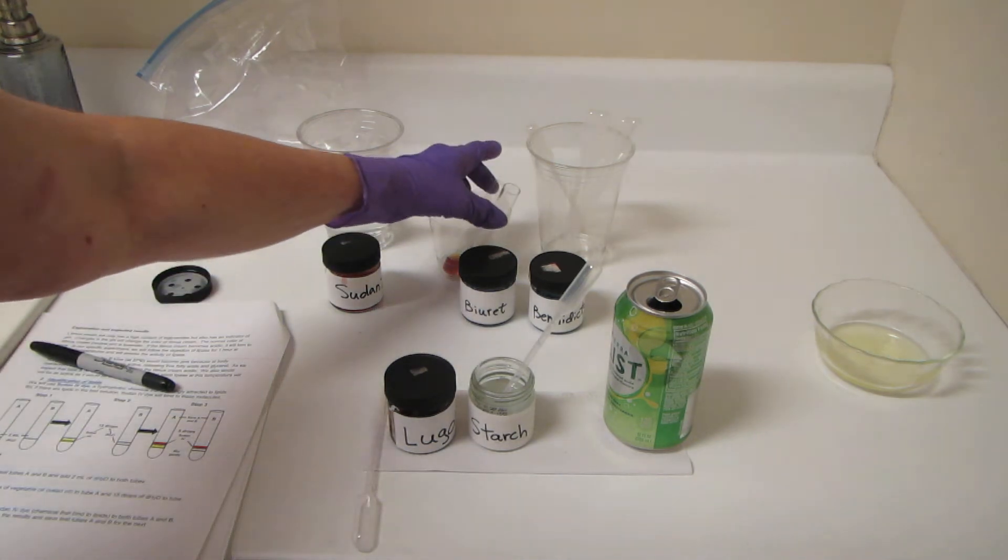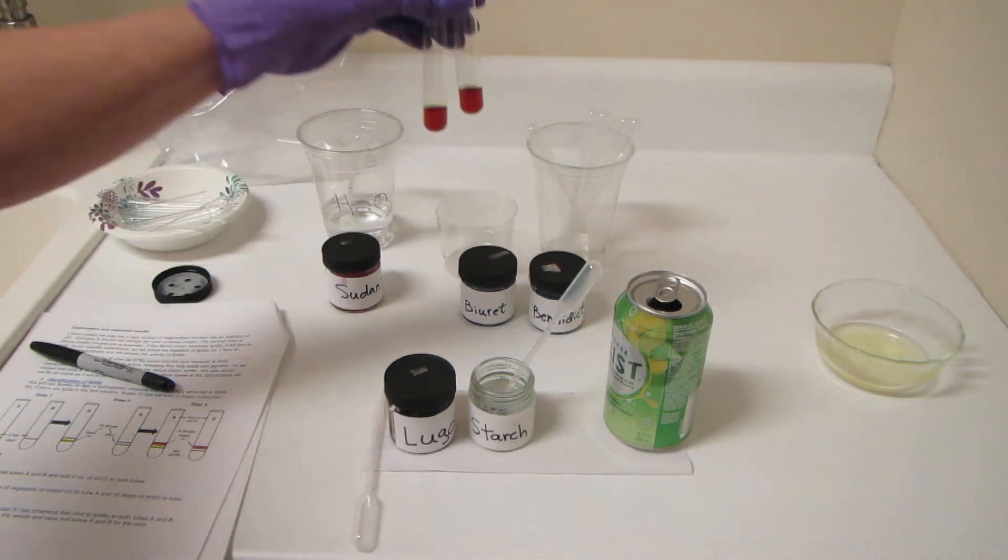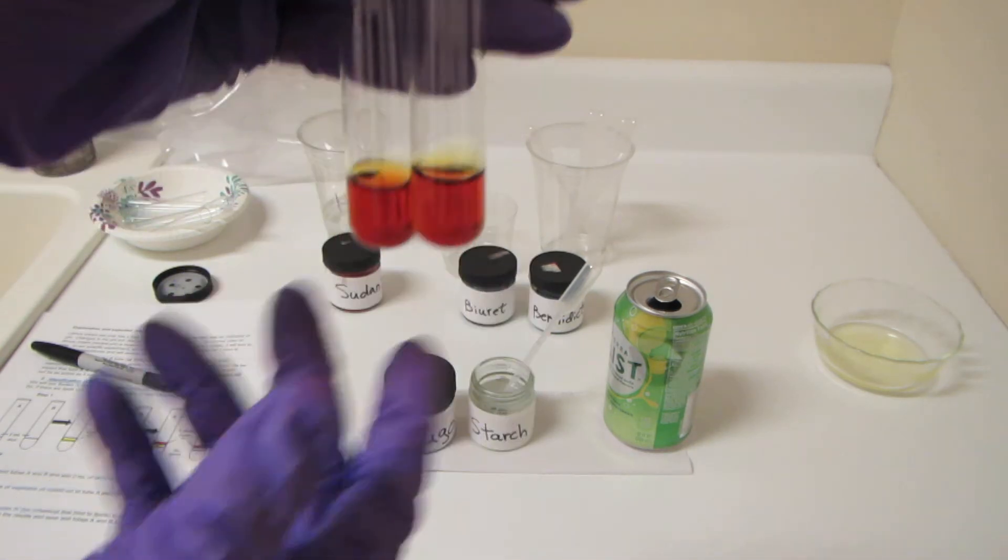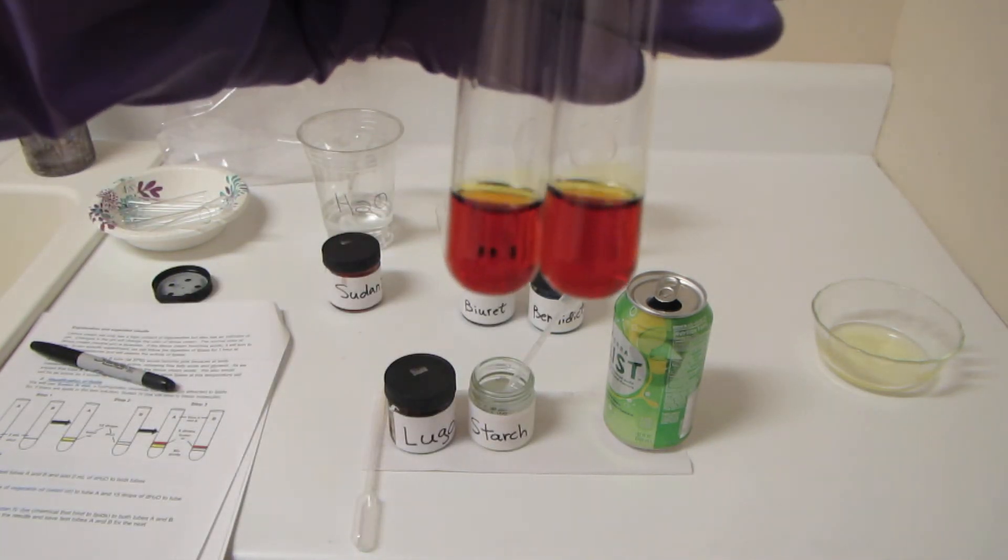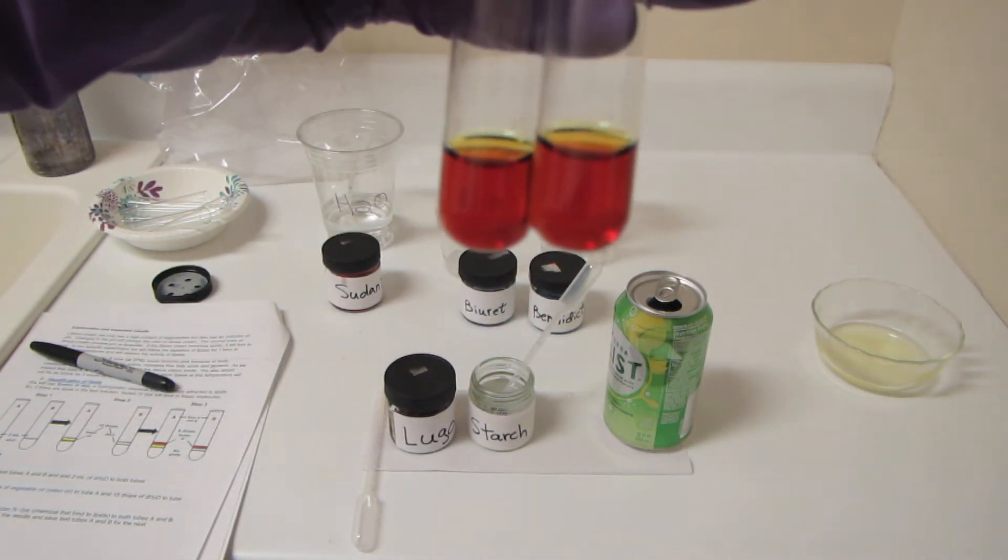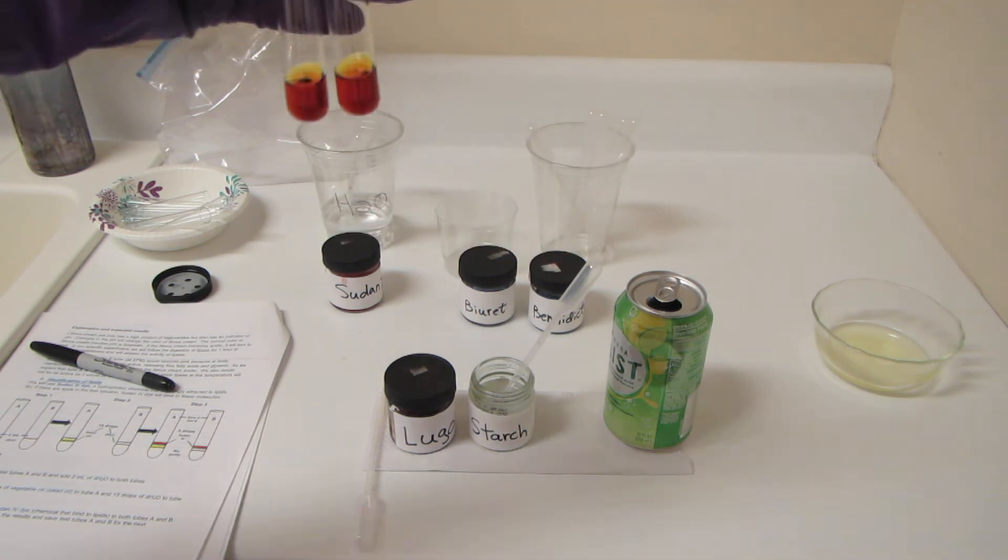Let's go ahead. I've got a couple of test tubes here, and I've loaded them up with Lugol solution. It's this beautiful amber-brown color just by itself.